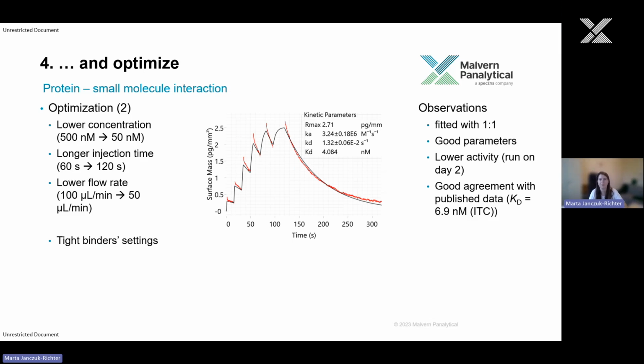Okay, let's lower the concentration tenfold, but also give it a little bit more time of interaction. And that looks good now. So we can fit it with one-to-one. We have good parameters and low errors. And also, we actually have a very good agreement with the published ITC data. So you can see here we got like 4 nanomolar affinity. Published data is showing 7 nanomolar affinity from ITC.